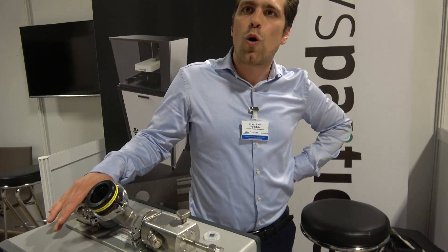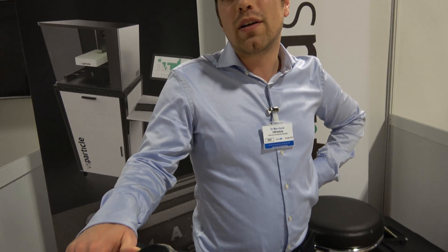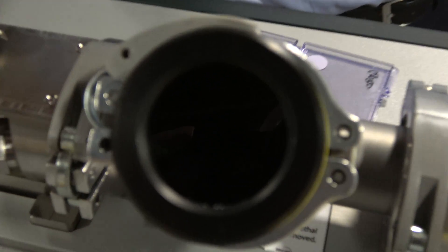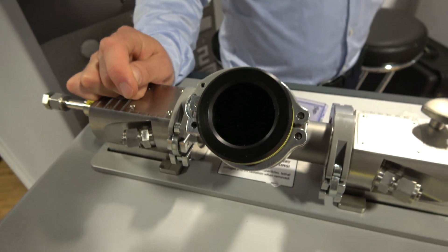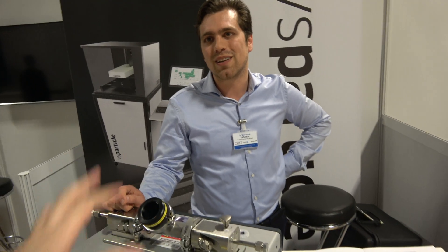One day you use gold, a few hours later you want to use copper. Normally if you do a wet chemical synthesis of nanoparticles, it takes weeks and weeks to find a new recipe. But here it takes five minutes to replace the electrodes. This is a window — when the system runs, you can see the sparks happening safely. This costs about 60,000 euros. It's not cheap, but it's also not very expensive. The price for the new system is still to be determined.